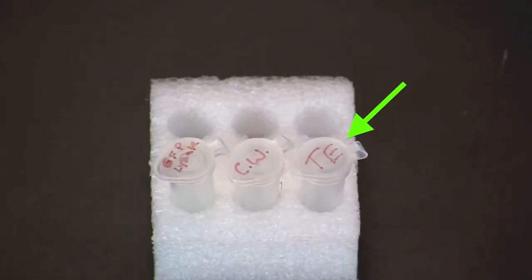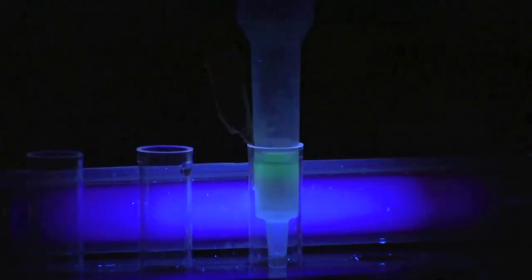Add 750 microliters of TE buffer. TE buffer contains no salt.